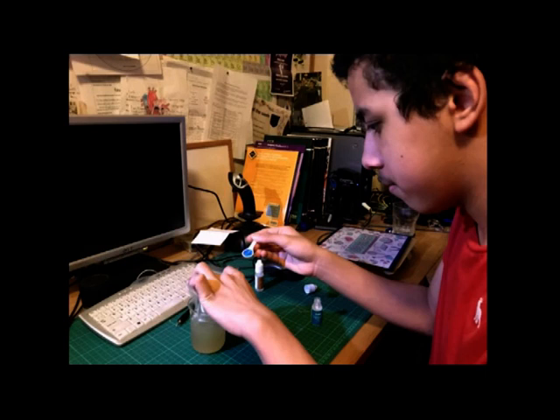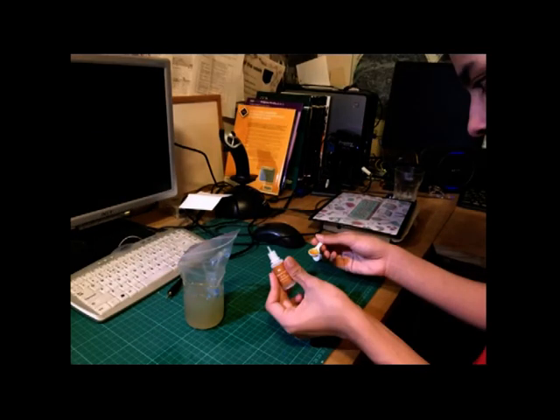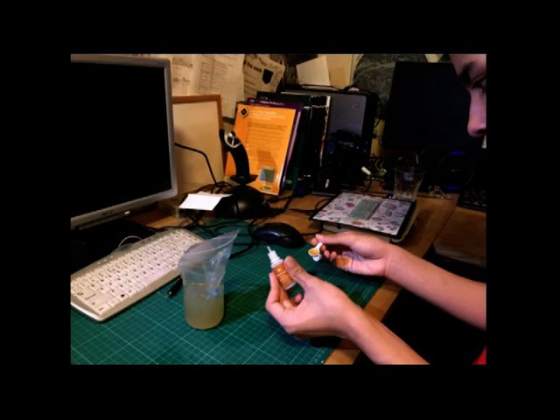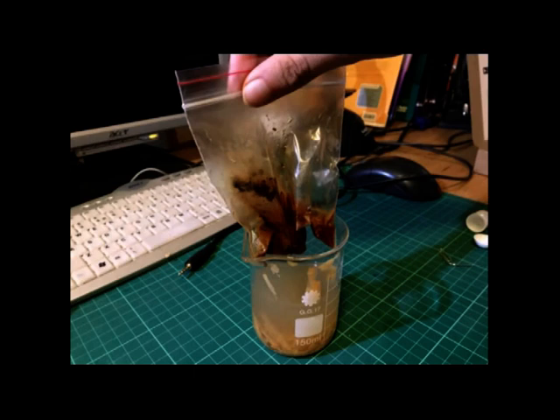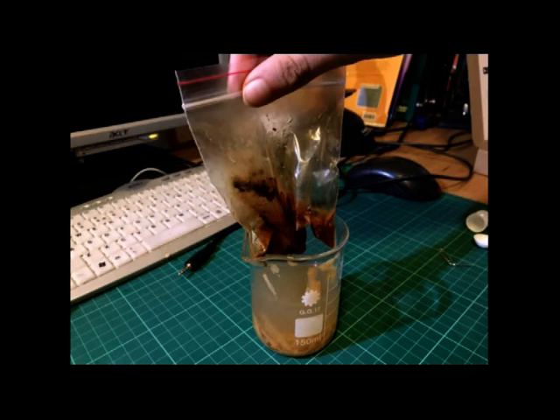You will see that the copper sulfate is a blue crystal. Then put two spatulas of potassium iodide into the plastic bag. As you can see, this is a yellow liquid. Now seal the bag. As you can see in this picture, the compound copper iodide formed is a reddish brown liquid. Also, elemental iodine is also formed.